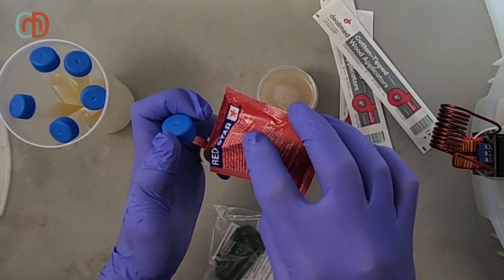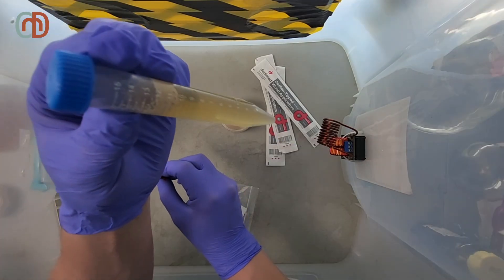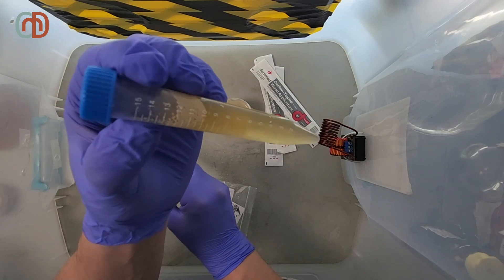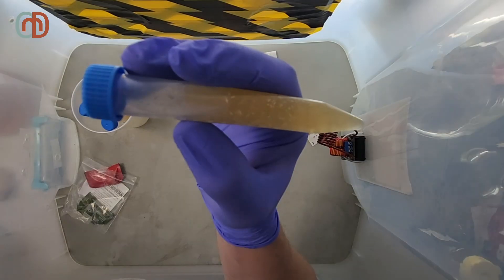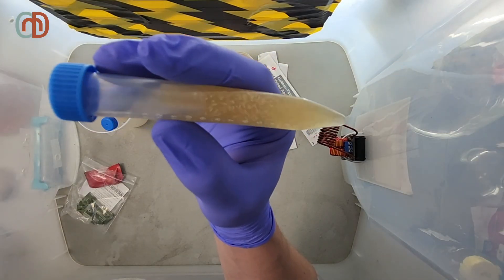I did my best to get a really small amount of yeast in, but I ended up getting more than I wanted. This won't be a problem though. Depending on the yeast you use, after shaking it, you may still see some yeast pellets floating around.